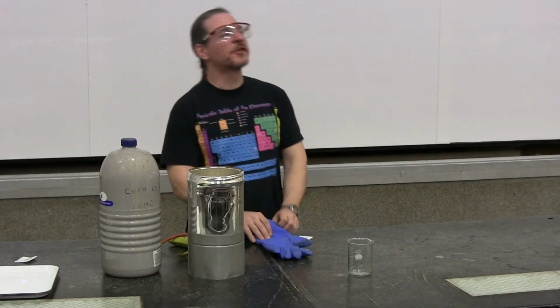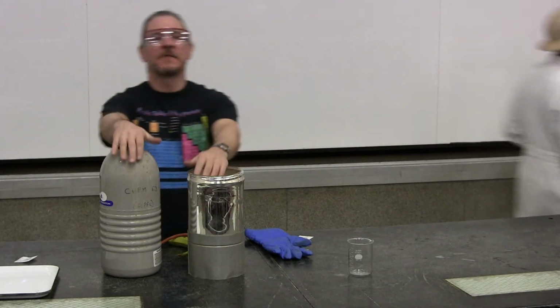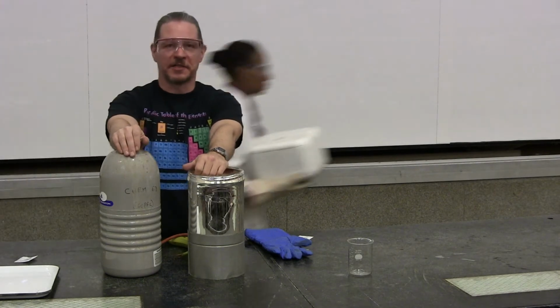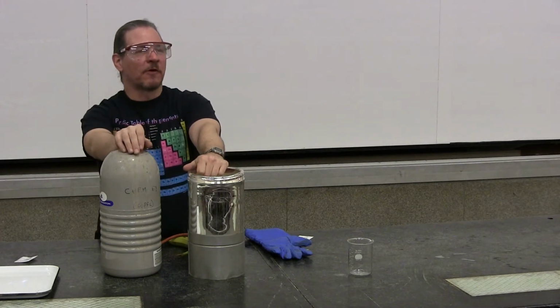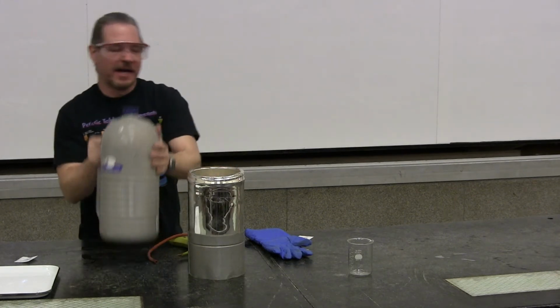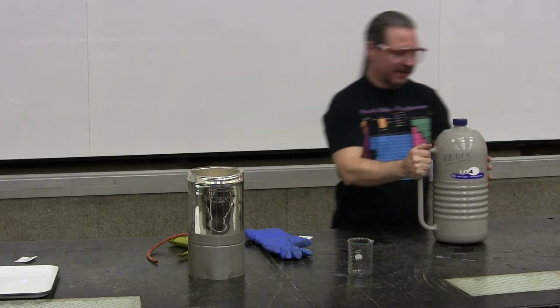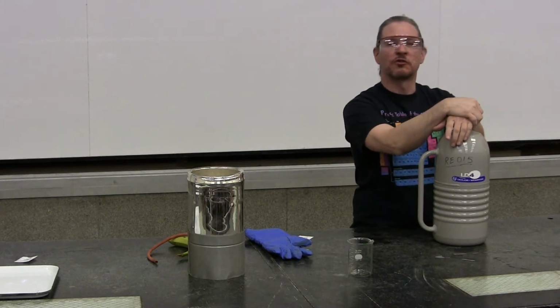Ladies and gentlemen, the dry ice you just witnessed sublimes at negative 78 degrees Celsius. It's pretty darn cold. We're going to go into the outright Arctic now. In this flask, called a Dewar flask, which is basically a fancy thermos, except they charge you $500 for it, and it is designed to handle extremely cold liquids.